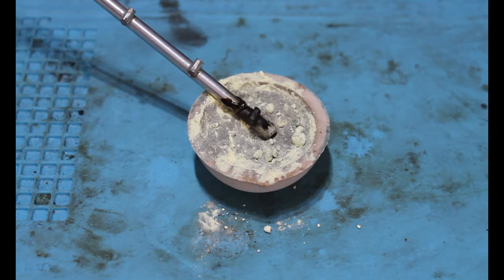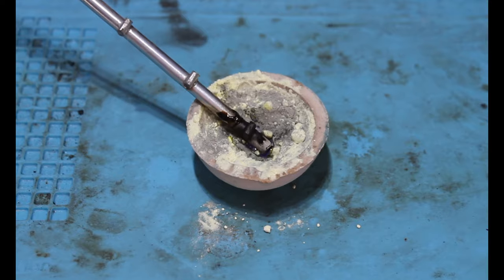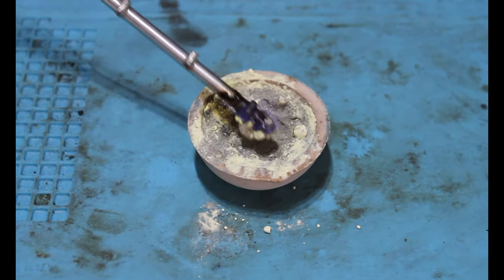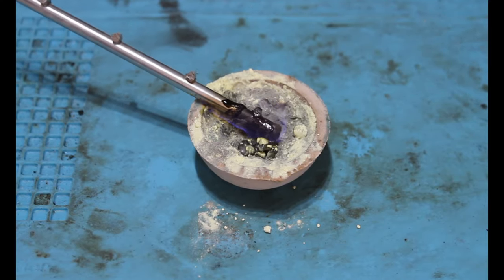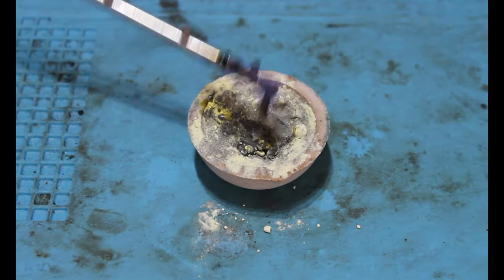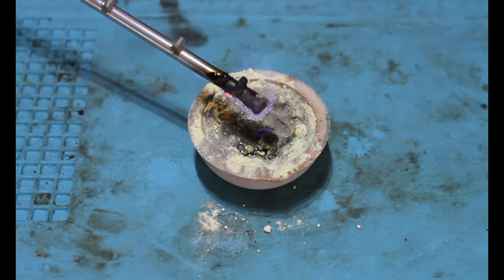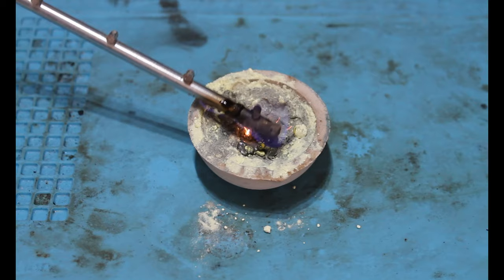For our source of ignition we're using a heated steel bar. Instantly upon contact we can see sulfur beginning to melt and combust. It does however take a small amount of time for the reaction to properly take place, but after about two minutes we see the reaction fully take shape.